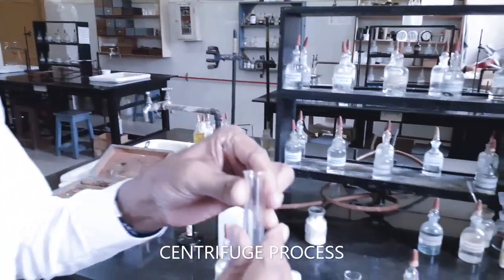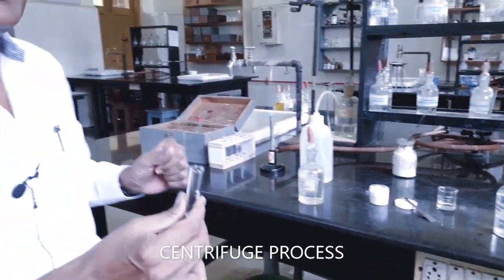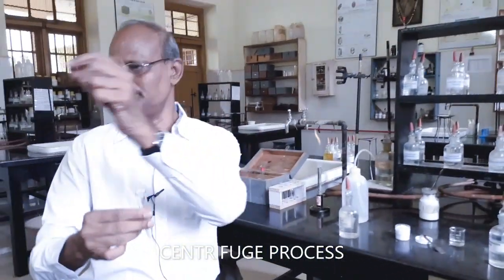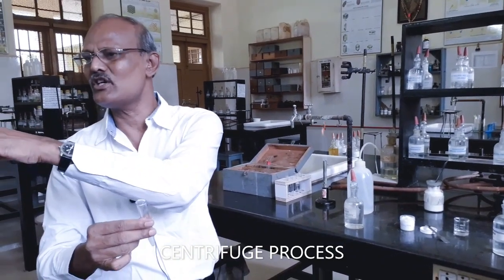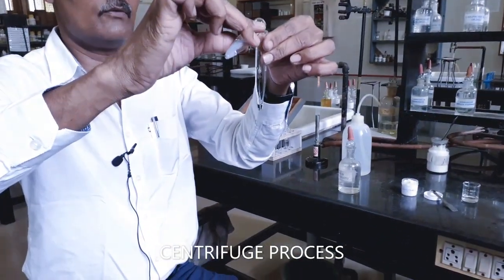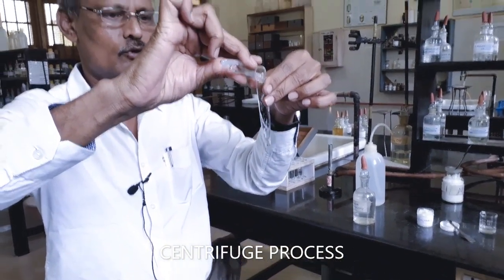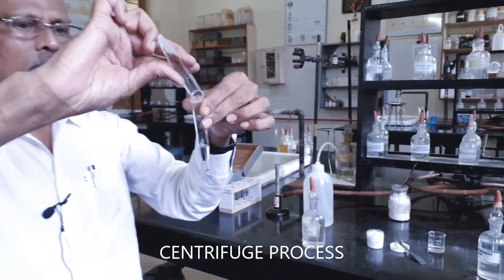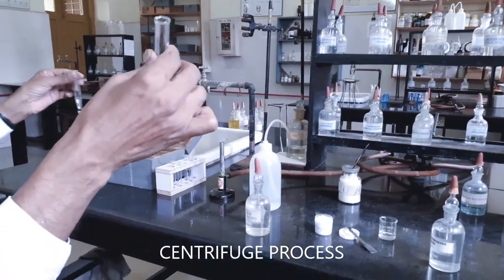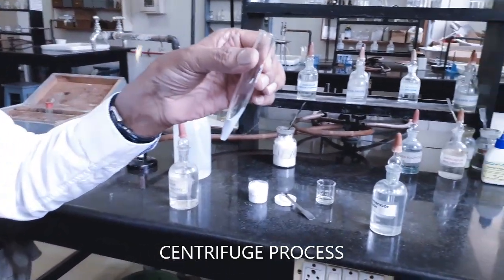The centrifugate, I am going to decant to another test tube, and we need this to carry out the detection of another basic radical. So now I am decanting the centrifugate to another empty centrifuge tube. This residue now I have to confirm whether it is aluminum hydroxide formed from aluminum or not.